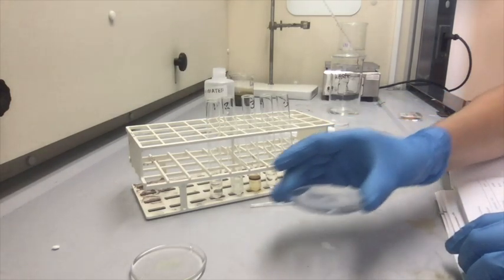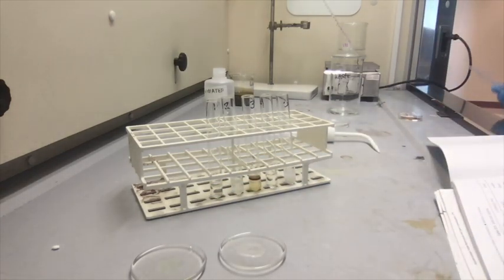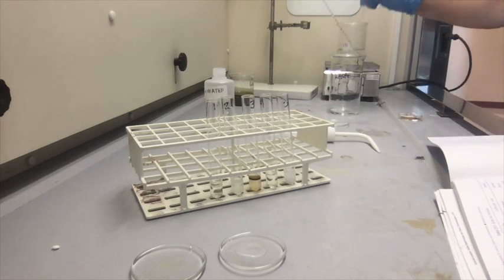I kind of feel like this one is peach, but I'm, again, not 100%. I'm not really that great with smells, so probably not the best person to be doing this, but anyway.